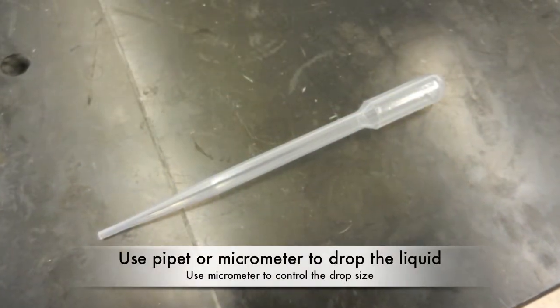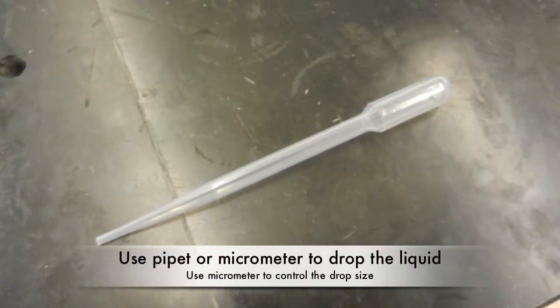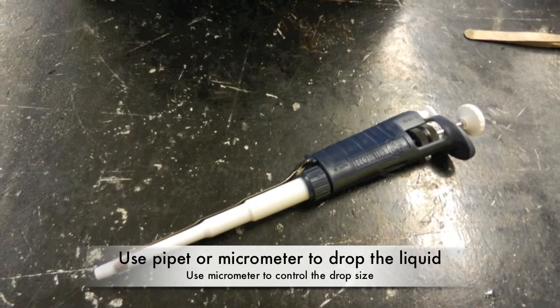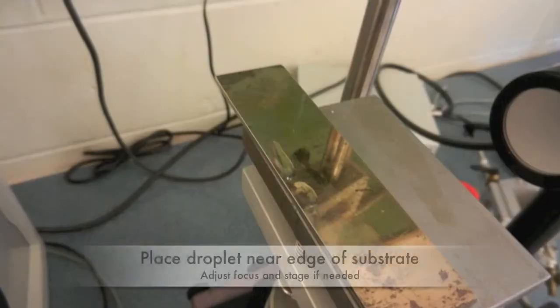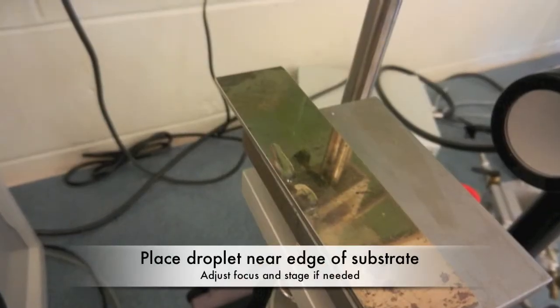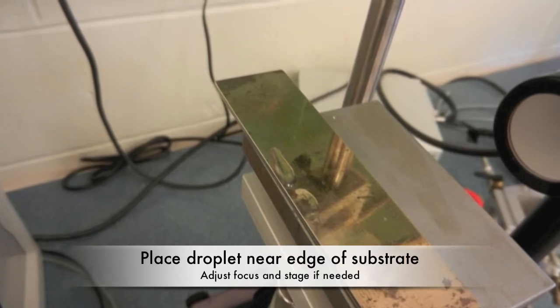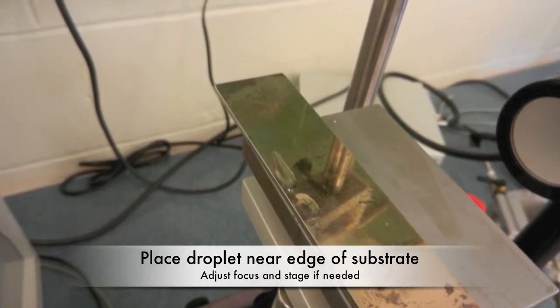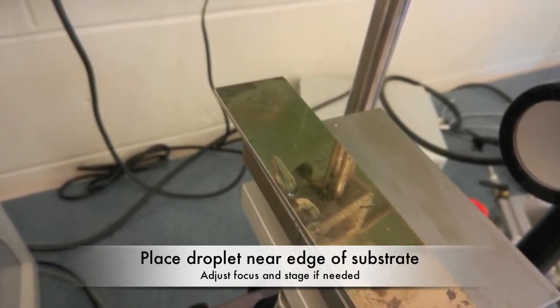Next, take a pipette or micrometer to drop the liquid onto your substrate. It is better to use a micrometer to control the exact size of the drop. Place a droplet towards the edge of the substrate closest to the camera. Quickly adjust the focus and stage if your drop is not in focus or within the window.